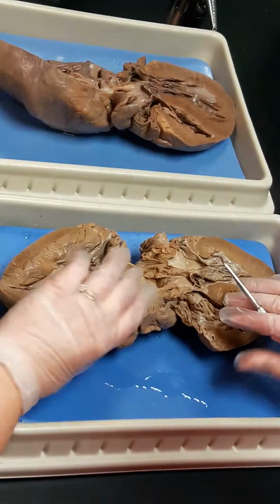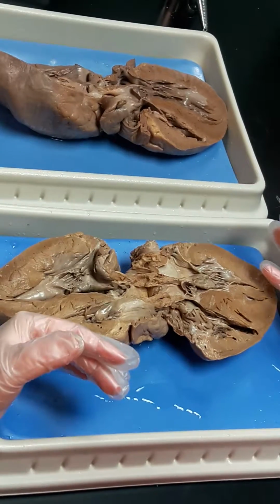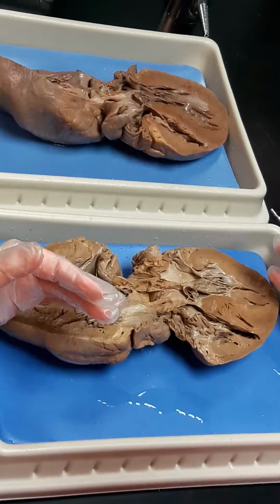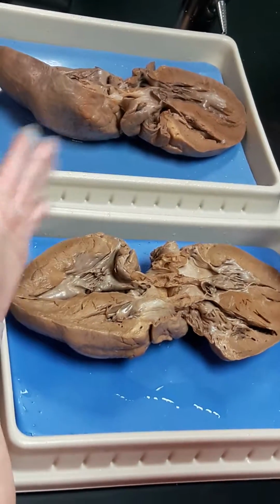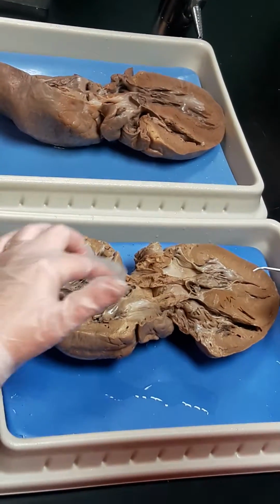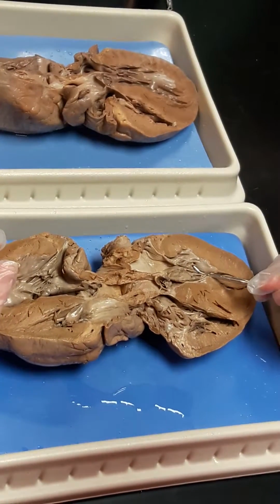Okay, the other hint I have, I'll point out the chambers next. Pay attention to the wording on the questions, because if I want a chamber, the question is going to say what chamber. If I want a structure, it's going to say name the structure. The reason I do that is because if I'm pinning a papillary muscle, it's going to be in a ventricle. I can't do it any other way. So for the chambers, we have the right atrium, the right ventricle, the left atrium, and the left ventricle.